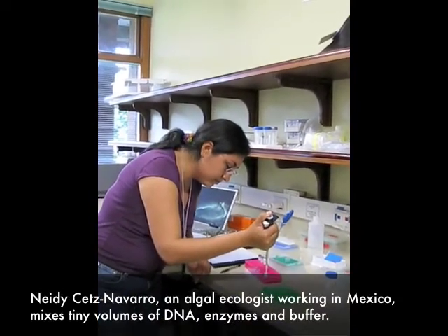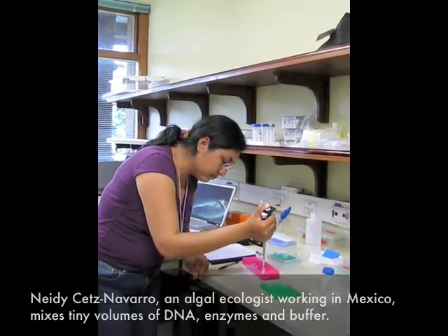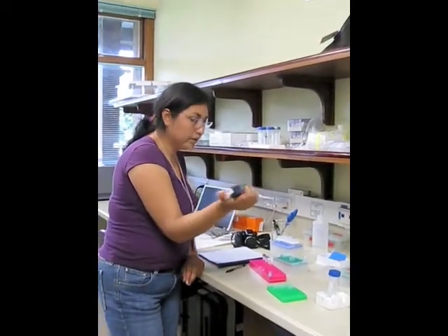It's good to put the tip down for a little bit — it's okay when you're mixing it up like this. If there's DNA down there, you contaminate it with the tip down. But since it's just solutions, it's all fine. Okay. Yep.